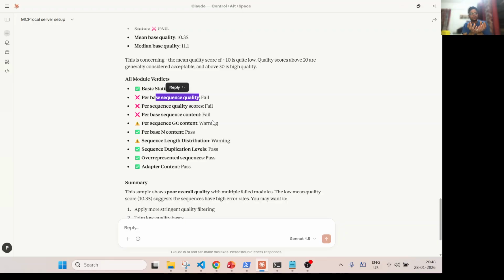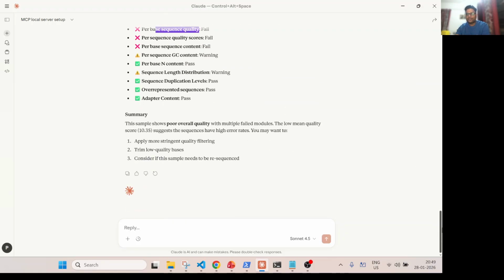So with MCP servers, you can provide the tools capabilities, and you can also provide the skills, which is a separate thing, not part of MCP. I'm just saying that tools, MCP, and skills, these three, you can play around with to make a very powerful MCP server. Okay, so that's what it's all about.